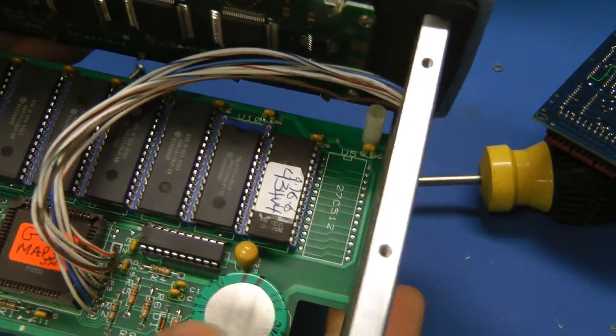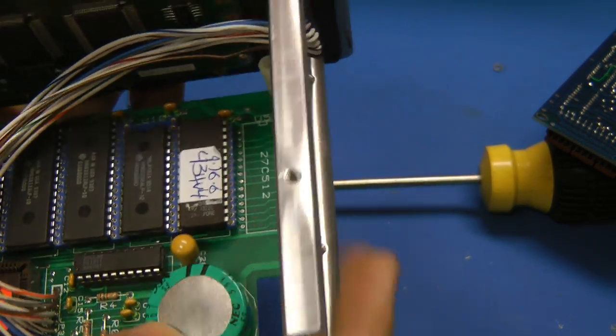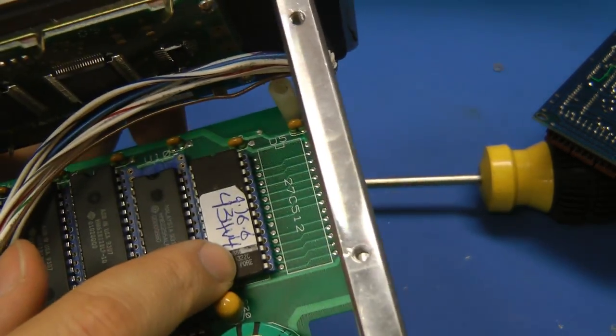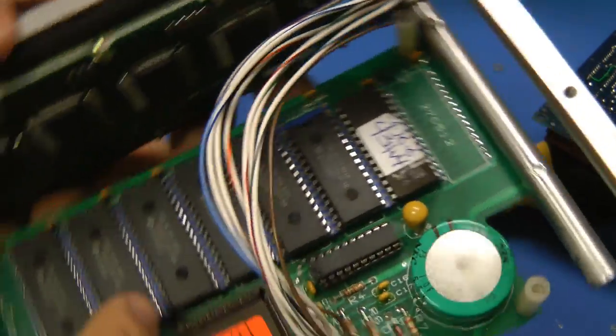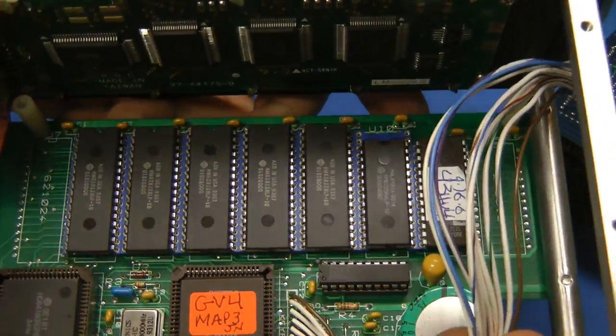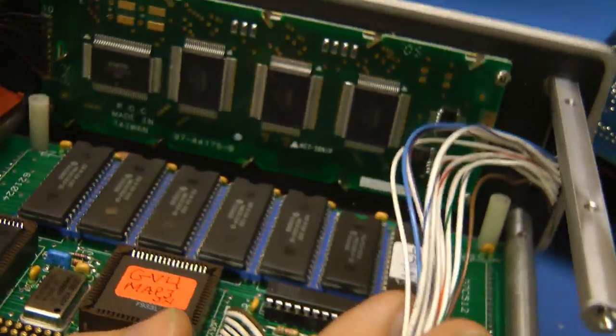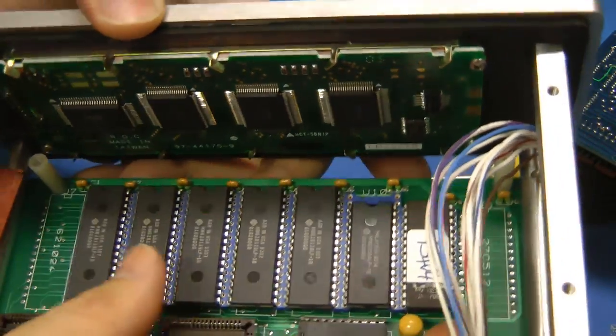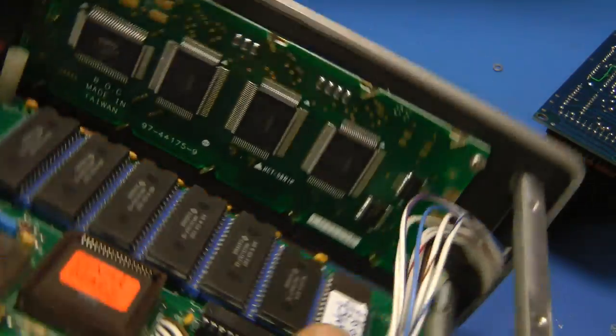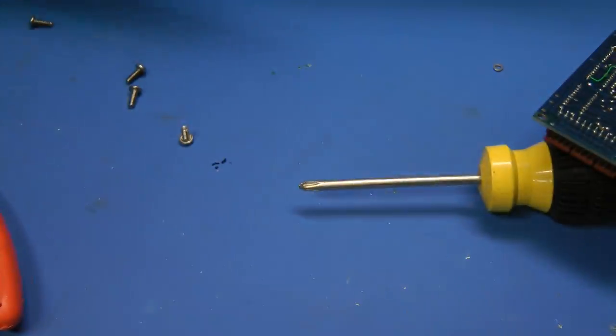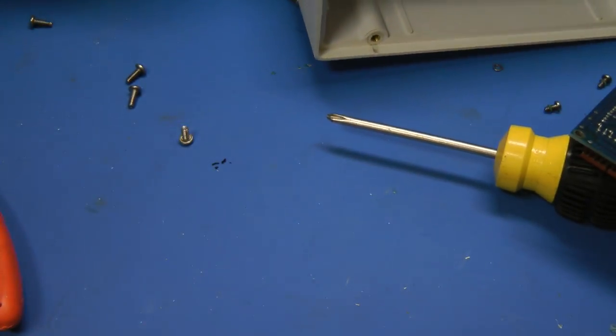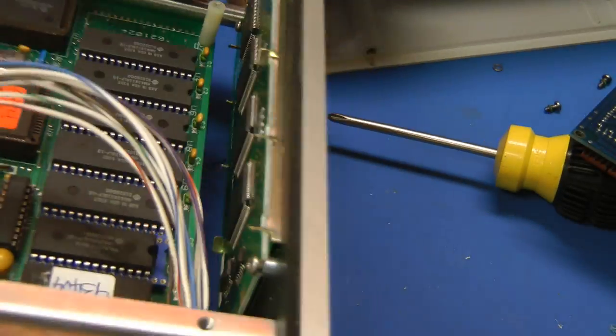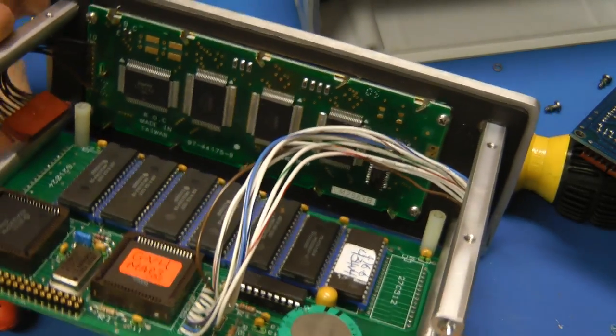In fact, yeah. There's an EEPROM here. And the rest is probably, all these other chips are probably just RAM. And they're storing, that's probably for storing trace data and stuff like that. So yeah, overall, there's not much in this thing. It's just injection molded housing. And a bunch of boards. Yeah, they didn't really expect this to be too interesting.